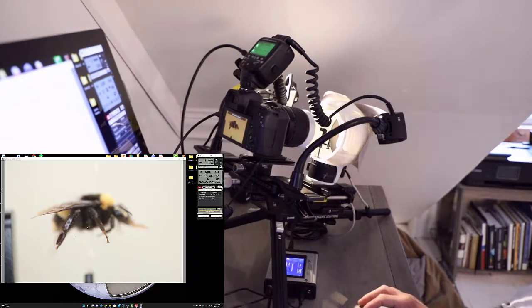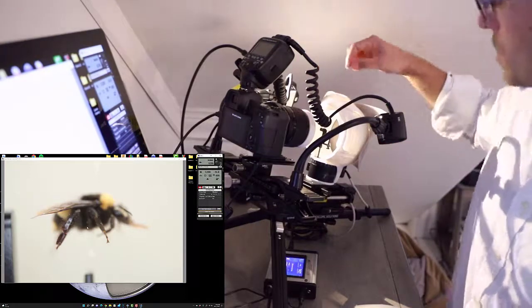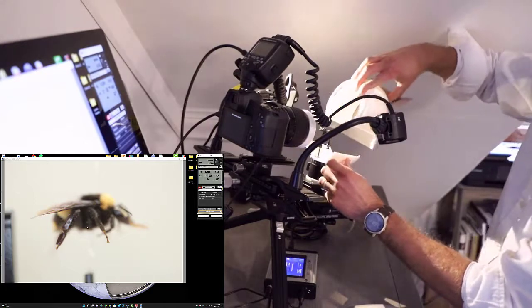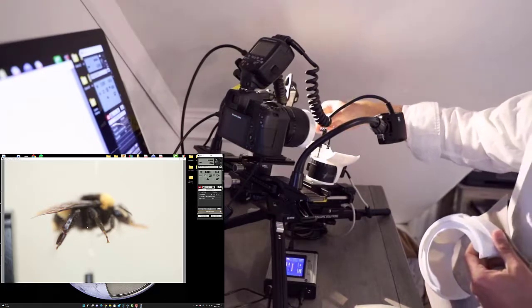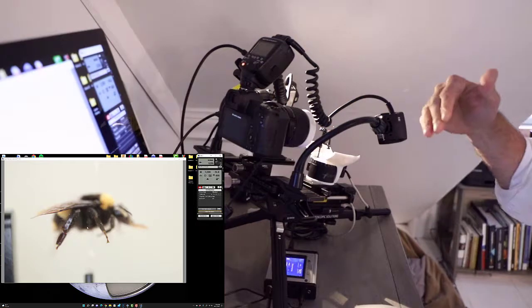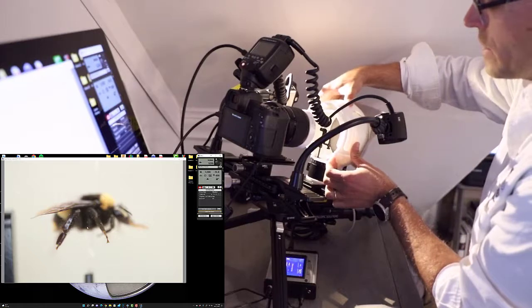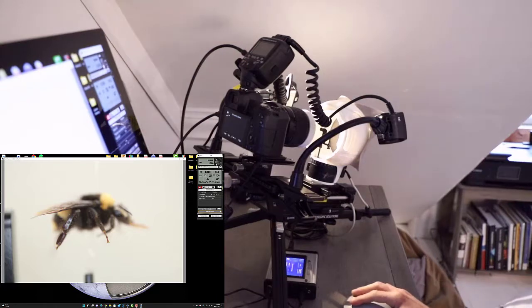The other thing too I kind of want to show is that you might be able to tilt the specimen forward a little bit. So I'm actually just going to pop the top off here of the dome so we can access it. Now it could be that the leg is actually completely parallel to the diffuser. So if we're to tilt the specimen back a little bit, it might actually reproject the glare towards a different direction. So it could be another tool that is available to you to reduce glare. So let's try that. We've tilted it a little bit. Take another picture and keep an eye right here.